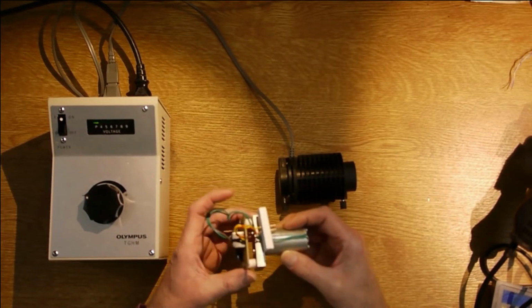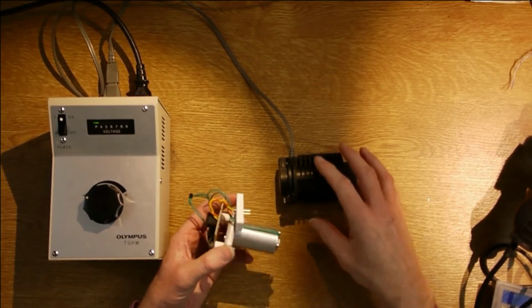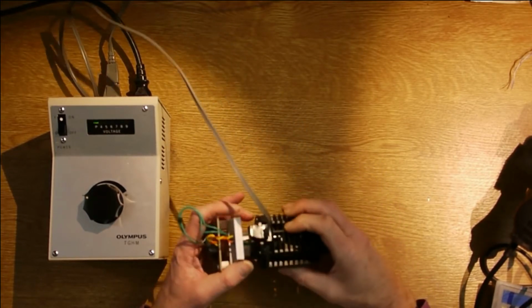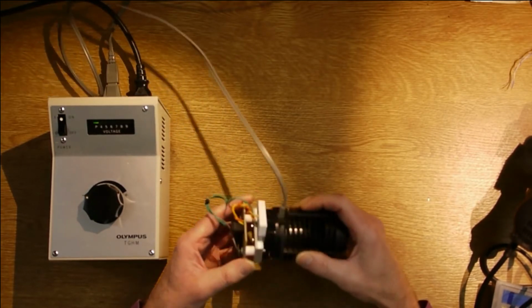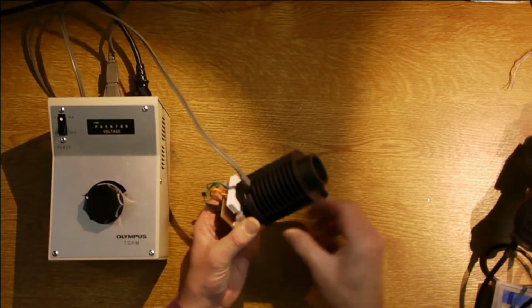shell. I didn't want to hunt around and try and find a connector that fitted and wait for it to arrive and so on. So that slides in there. That slides in there. And then that screws up.